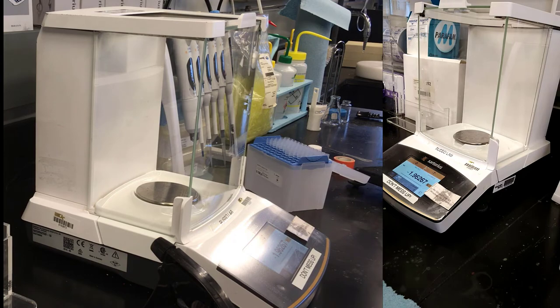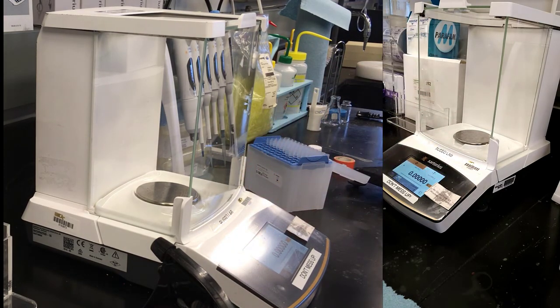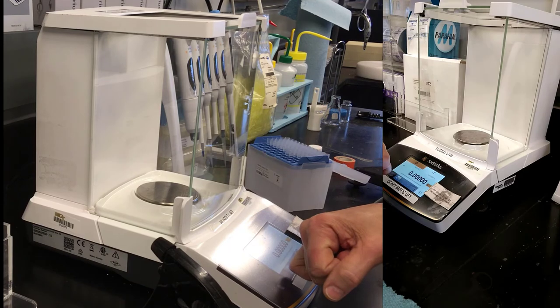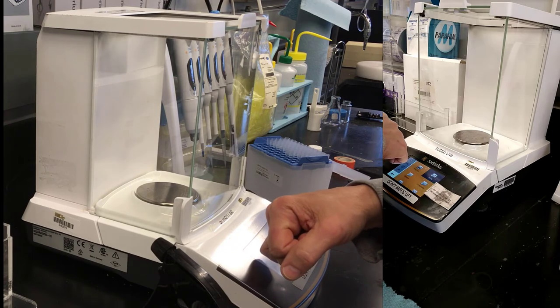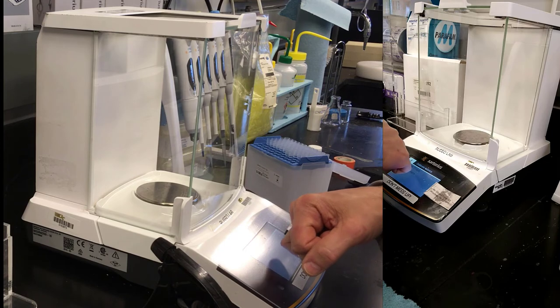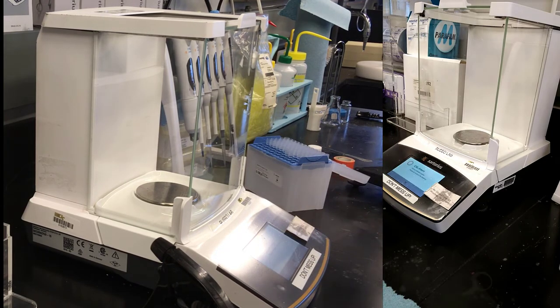Okay. I should probably hit the zero so it goes in. Now, one thing that you might want to check, it's usually okay, this machine. It's a little dot down here at the lower left. You can push the CAL button. And you can do an internal or external CAL. I recommend the internal. The external would be that you put on weights of known amount.